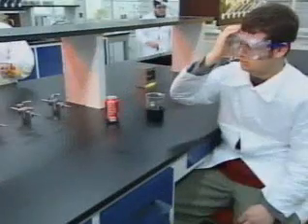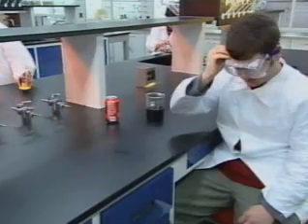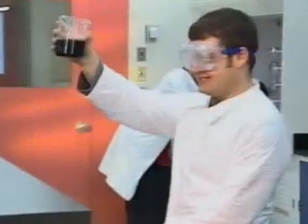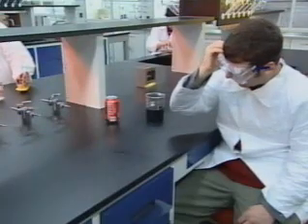Oh my, we've got a man down over in the corner. I repeat, there's a man down. He's holding his head and looking a little woozy. Mia, we seem to have one of these incidents every year, and it burns me every time. Somebody wants to be a clown and drink from the lab equipment. Not really funny now, is it?